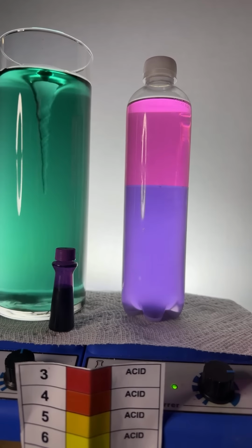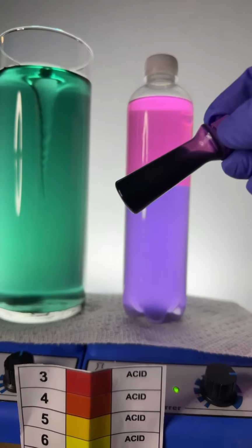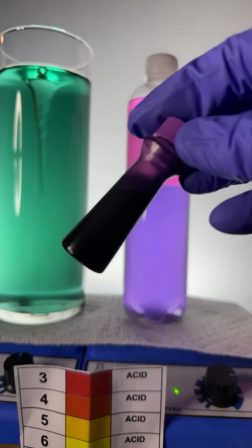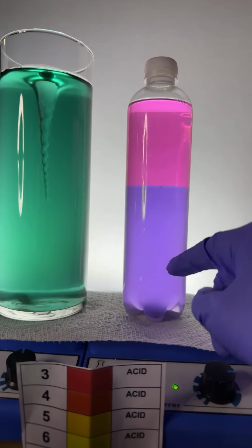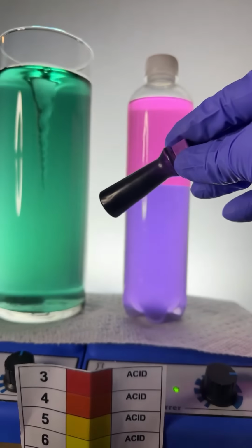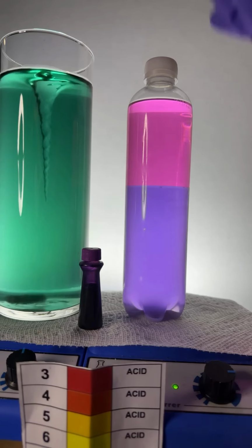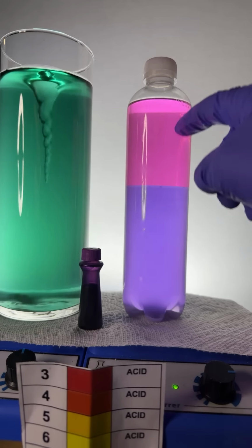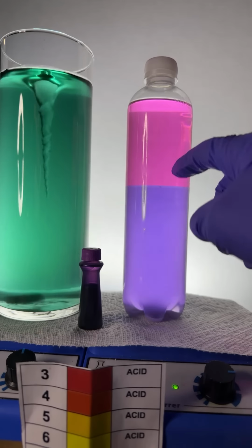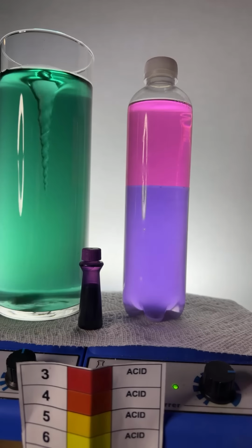Thank you there, Mr. J. I appreciate that. Now, the reason why you see the two different colors is because there's two different colors in this dye. You can see them right here. One of them's kind of this pinkish color. The other one's kind of this violet blue. Together they give you this neon violet, neon purple. And indeed, it's very easy to see that the pinkish dye dissolves better in the acetone layer, and the blue dye ends up dissolving better in the saltwater layer.